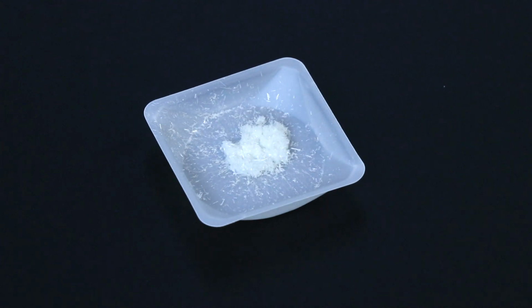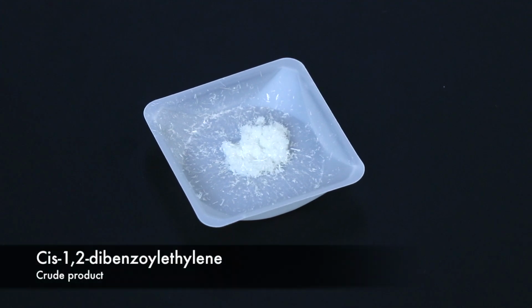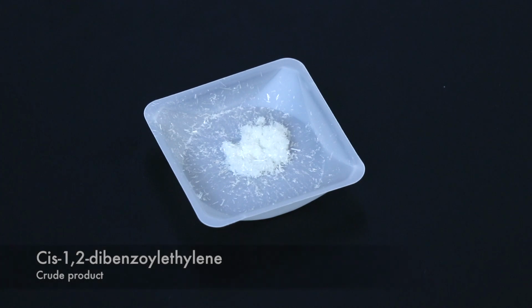I'm going to show how to recrystallize a solid product, and for this video I'll be using the product formed in the photochemical isomerization lab. So this is cis-1,2-dibenzoyl ethylene.